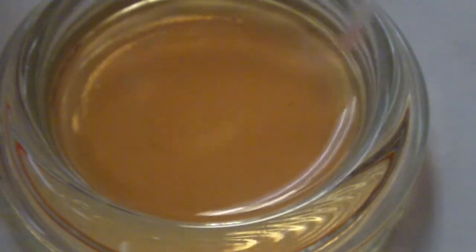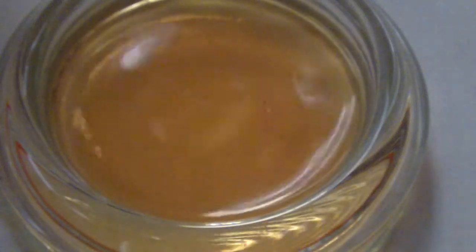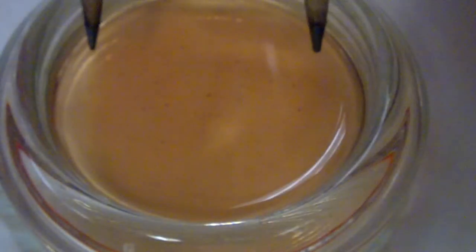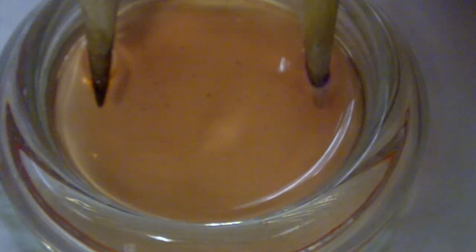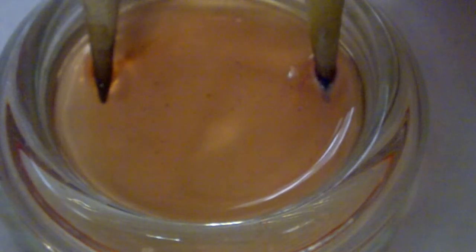So adding the phenolphthalein indicator. Getting a swirl here, actually stir it around. No longer colorless. Should still be able to see a difference. Putting the electrodes back in. So I see strong bubbling on the cathode, a small amount of bubbling on the anode.